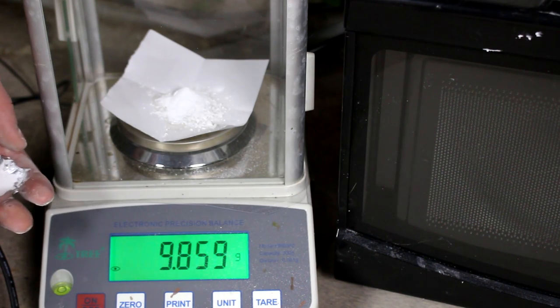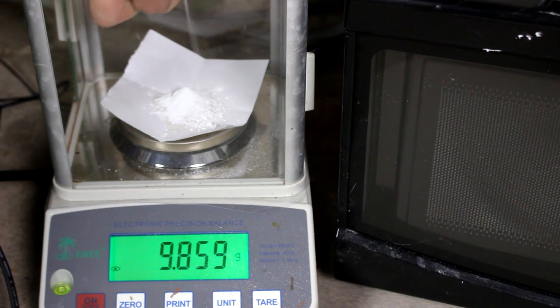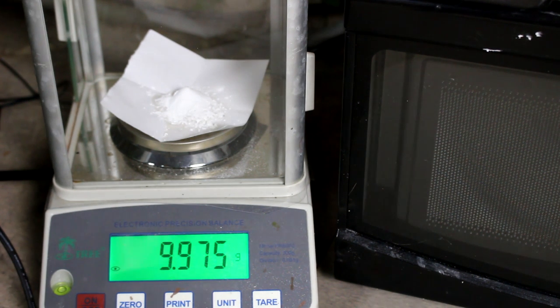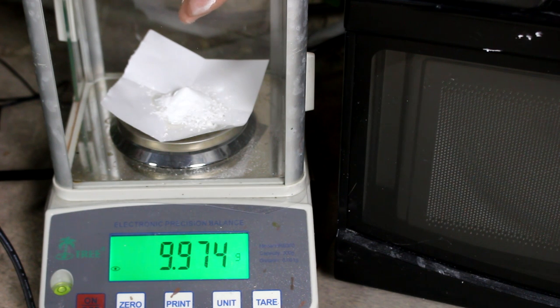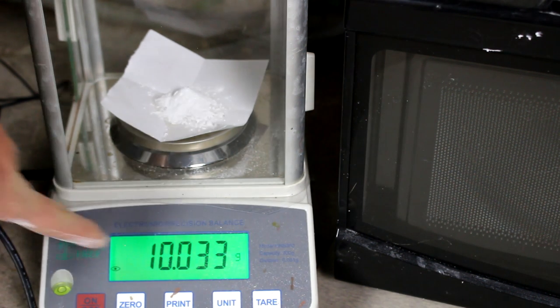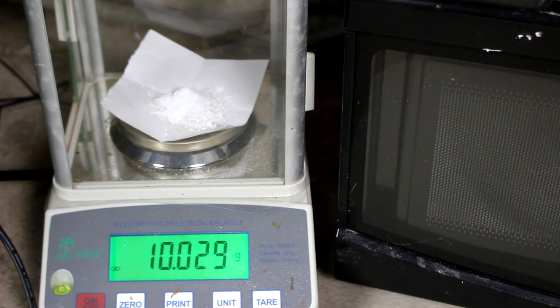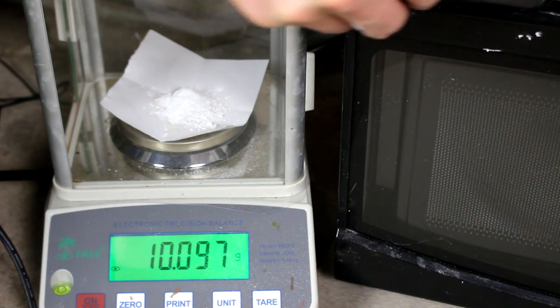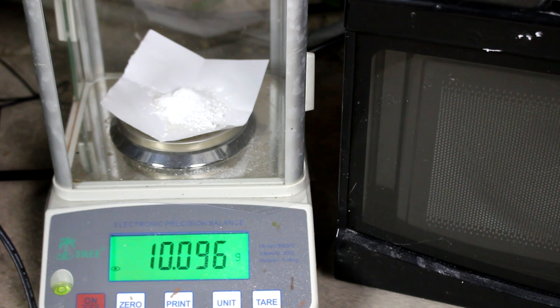So I'm going to need approximately 0.1 grams of aluminum oxide. Not very much. And about the same amount of magnesium sulfate. That already brings me up to my target of 10 grams, but I am going to add just a tiny amount of the potassium nitrate and an even smaller amount of antimony. Okay, I should just about do it. I think I went a little over on the antimony, so I'll just add in just a little bit more potassium nitrate to compensate. That should do her.